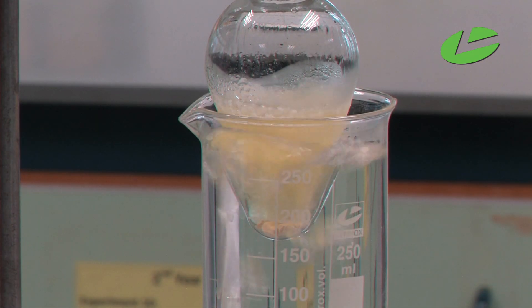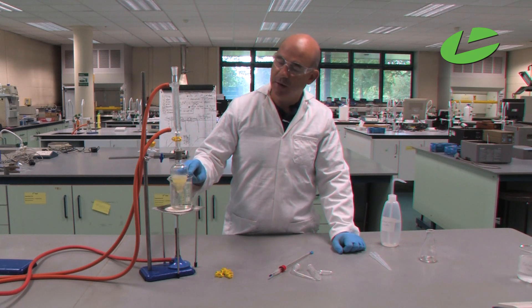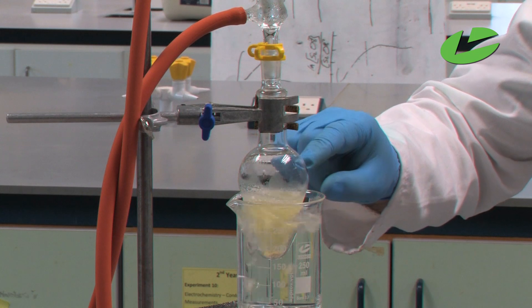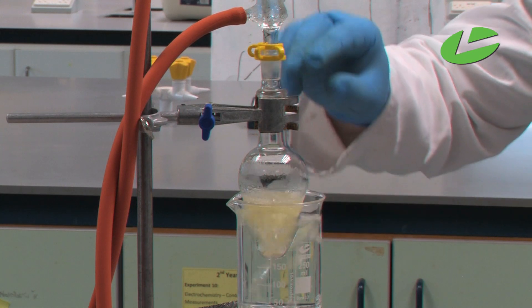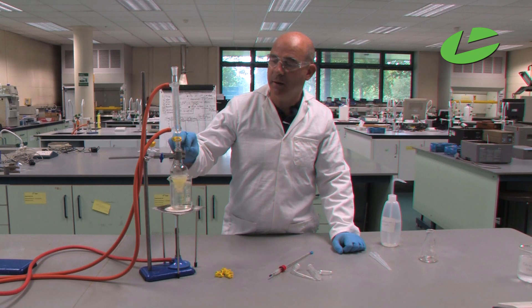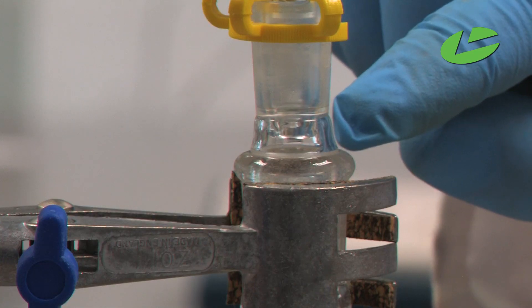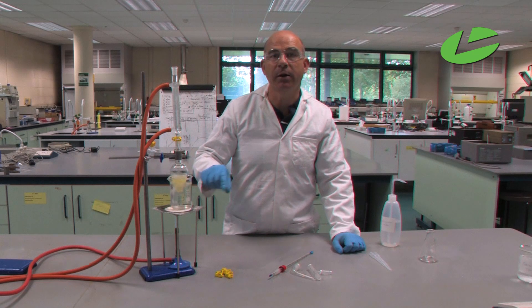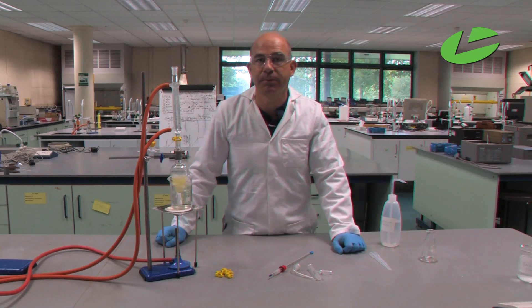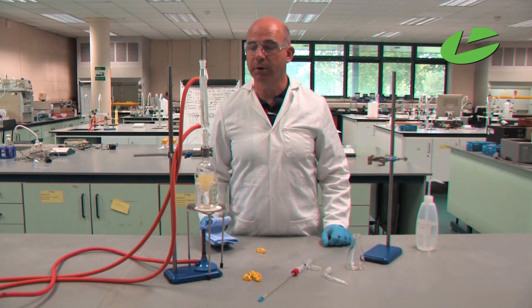Now that our water is boiling and the reaction is up to temperature, we can see that the ethanol is boiling. The ethanol vapors are leaving the pear-shaped flask, rising up, hitting the cold wall of the condenser, and falling back down into the solution. We can see the drops of ethanol falling back into the reaction mixture, so the ethanol is being recycled as the reflux continues.